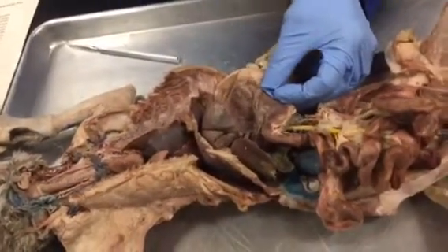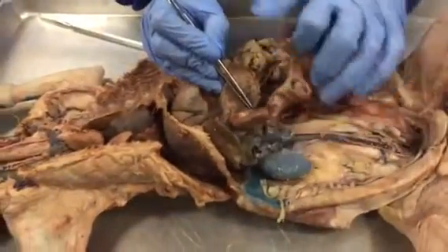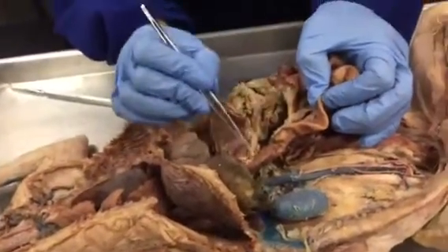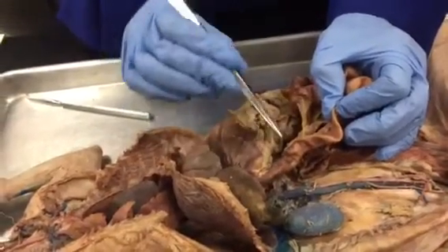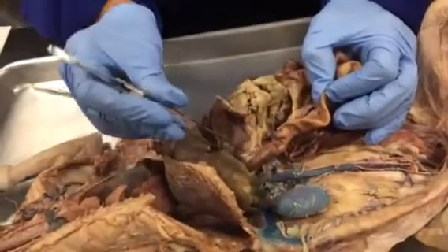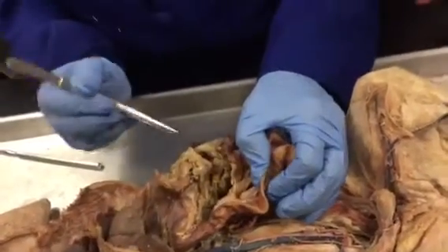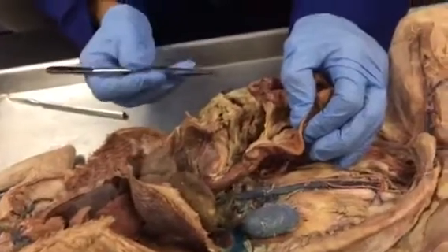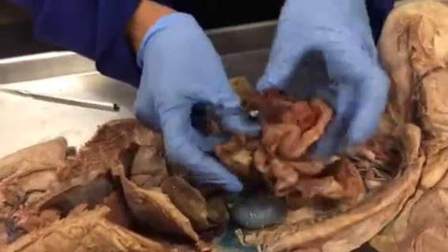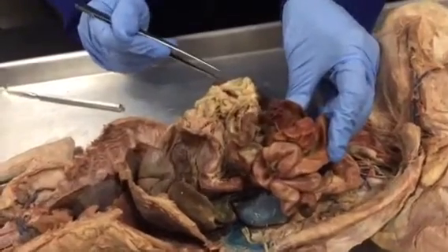Duodenum. So the small intestine has three parts. The first part is the duodenum. So see which part is attaching. Here is the stomach, and this part is attached to the stomach. That is the duodenum. So if you are not sure whether to say duodenum or just small intestine, look at whether it is attached close to the stomach. If it is, it is the duodenum, because the small intestine has three parts: the first part is the duodenum, the second part is the jejunum, and the third part is the ileum. All this you see in the center, the entangled part, this is the small intestine.